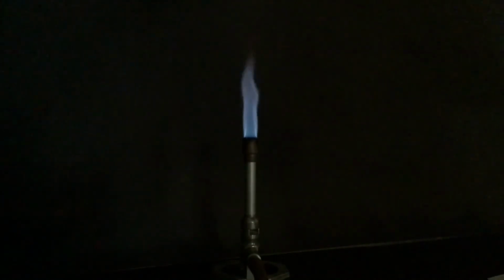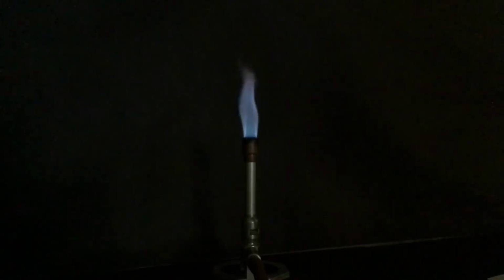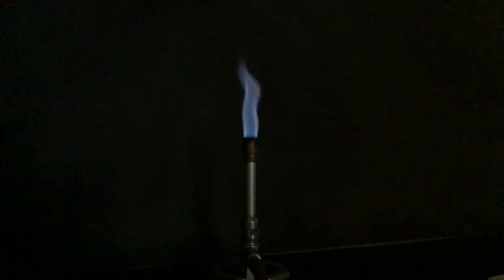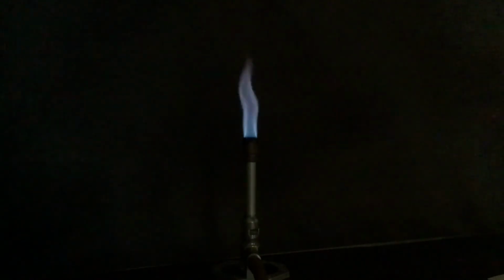Okay, so the last thing I'm going to test then is an unknown. This will be one of the 7 things that we tested. You're going to have to tell me the identity of the unknown. And I realize many of them look similar. So try to really focus in on some of those details if you can't tell which of the substances it is. Also, you'll have some extra clues in the next part of this where you look at the emission spectra of each of these substances.